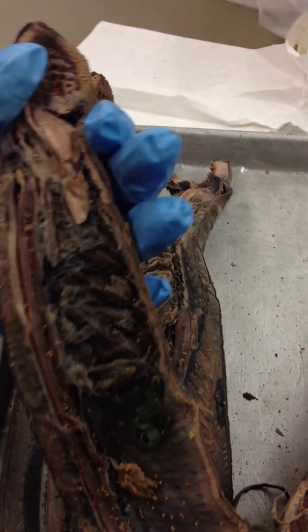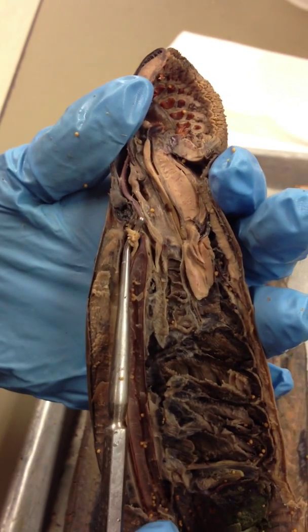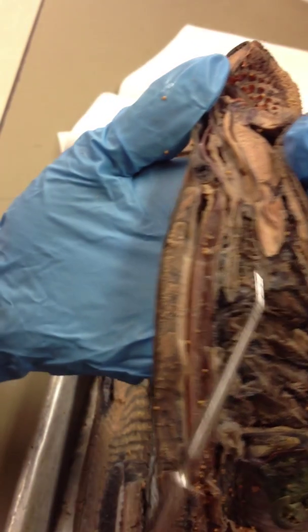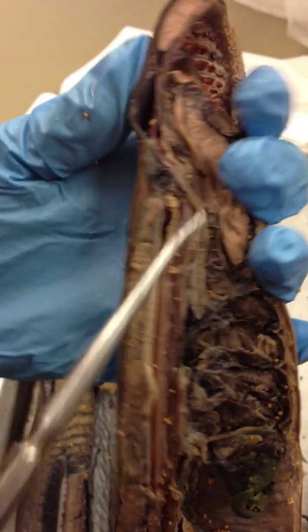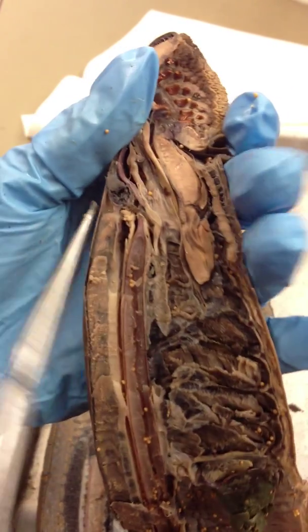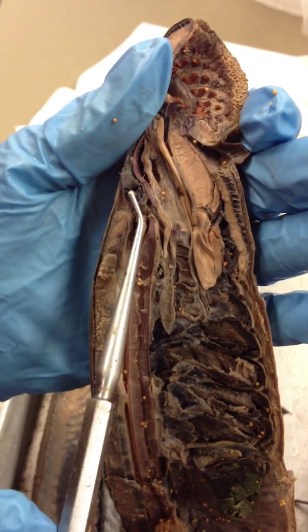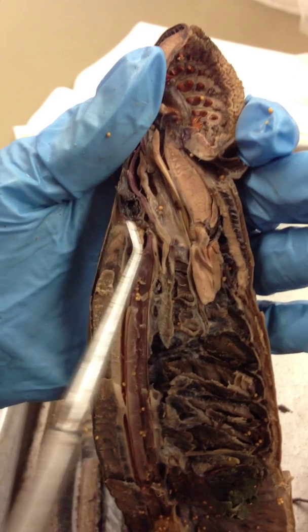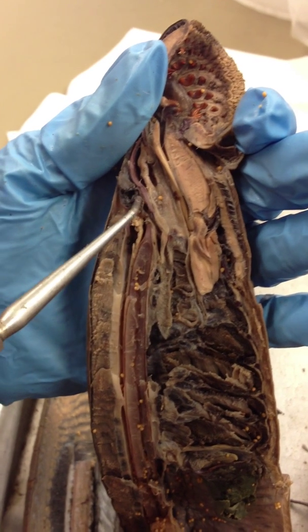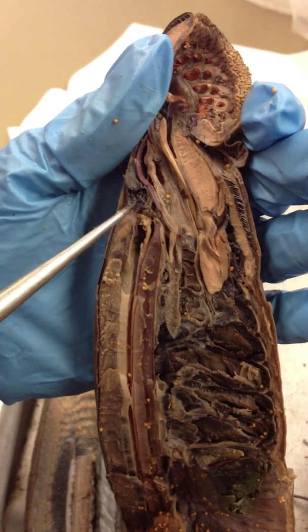Right here — the brain is right there. It's really tiny. And as we said in the other video, your nasal opening should take you to your nasal hypophysial tube, this tube, into the olfactory sac, and your nasal hypophysial sac. But they're all kind of jumbled up in there.